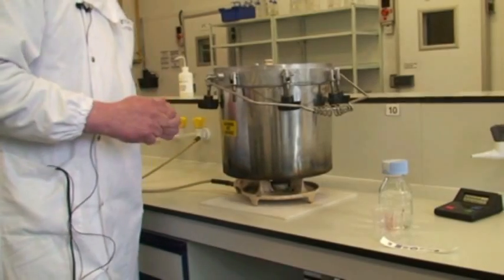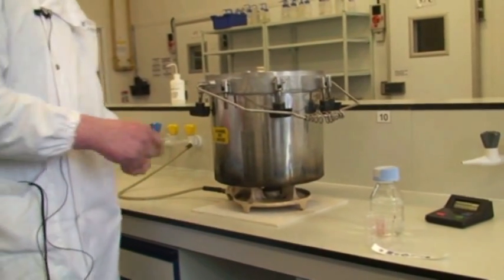Okay, so we're going to use a portable autoclave today just to sterilize this sample of water.